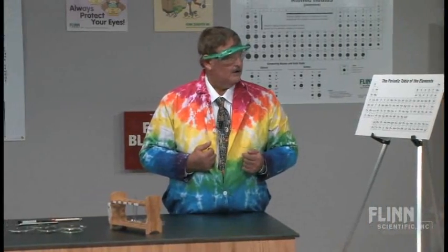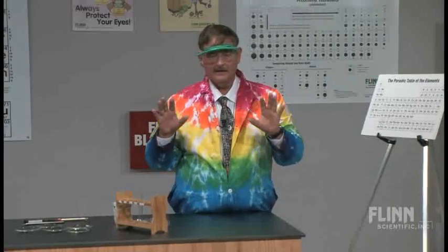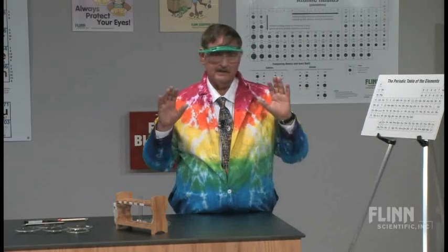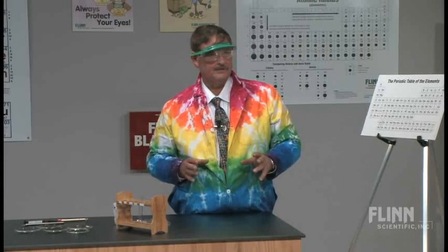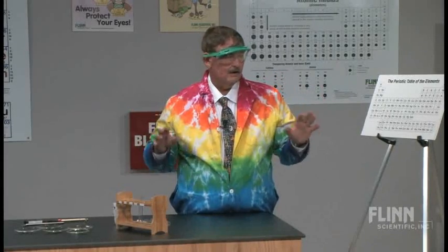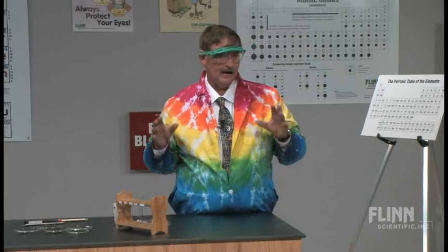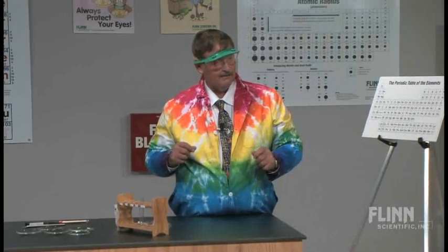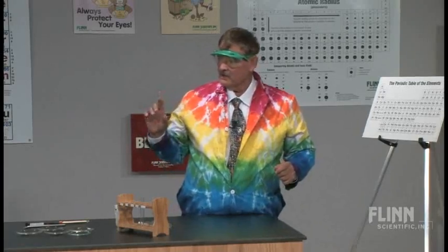All right? So, again, making glass, if they're into art at all, is something that is going to make some students from that day forward love chemistry, because now they see a relationship between the art and the chemistry. And the last thing I want to do is let's take a look at this glass.